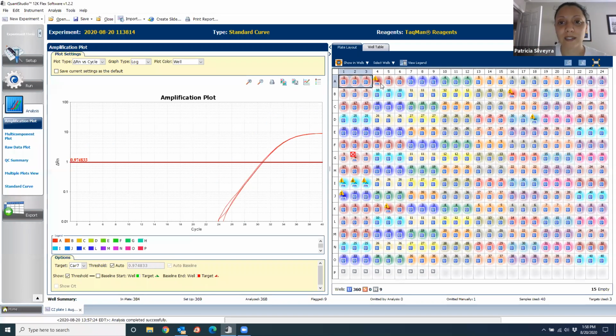Now the next one, we have 3, and what happened here is that this looks like a pipetting error. So maybe you got some air in the tip, or maybe when you pipetted in that well, it didn't centrifuge well, it didn't go well to the bottom. Multiple things can happen. Sometimes there are just bubbles in the master mix that has detergent, so you can't avoid that. Because you know that this is a technical issue from the way it looks, and because it shows you the triangle here, we omit that.